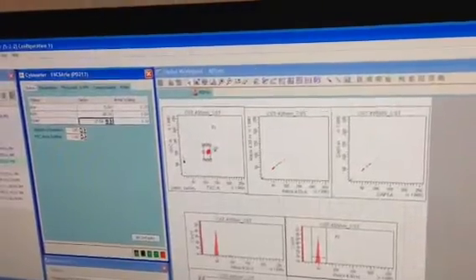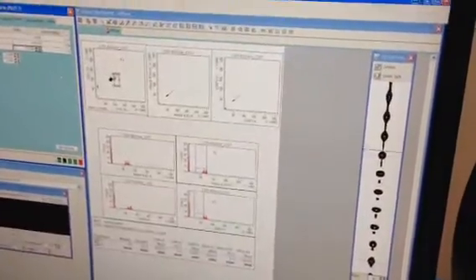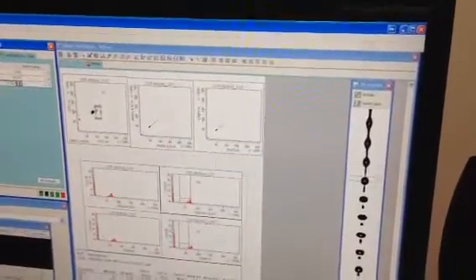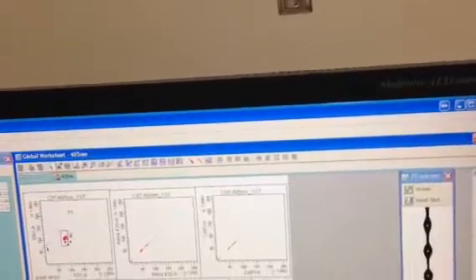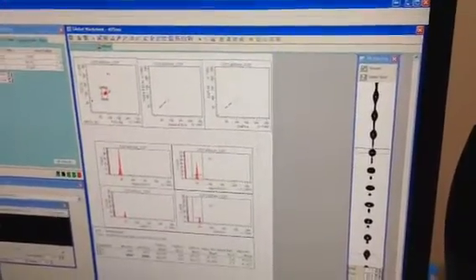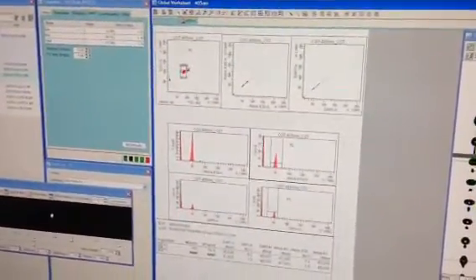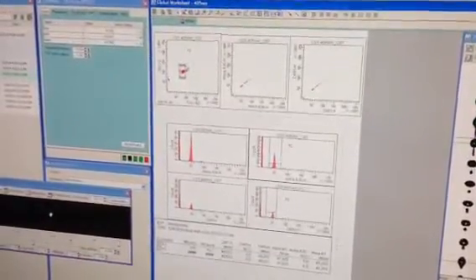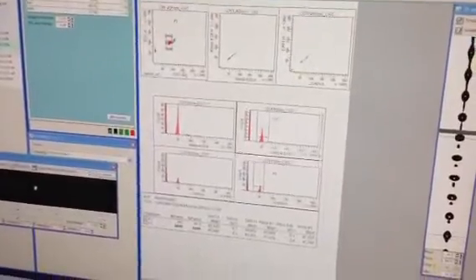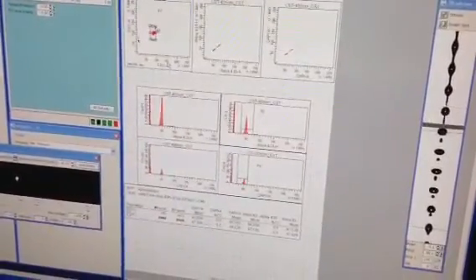So for example, if I change the window extension to 0 and my signals suddenly drop out completely or become sort of ratty, kind of like this. When we change the window extension, we do lose some signal strength. So if the window extension is changed to 0, and we suddenly lose signal or the signal drops, we know that the laser delay is not set optimally for the bead or particle itself to be in the center of the window. So we would adjust our laser delay at this point to have the signal maximized at the 0 window extension, so that when we open up the window extension, we'll be seeing a complete signal very clearly and consistently.